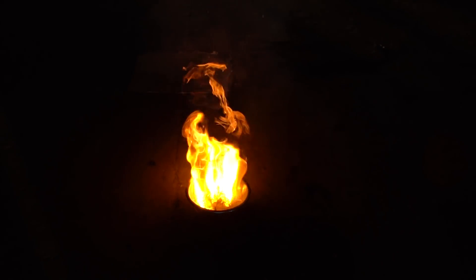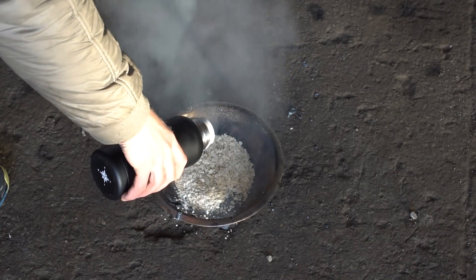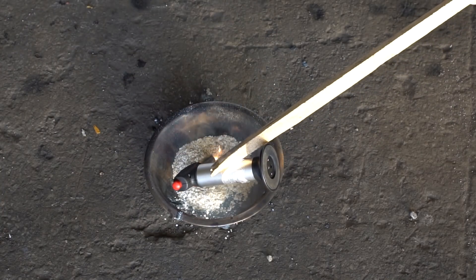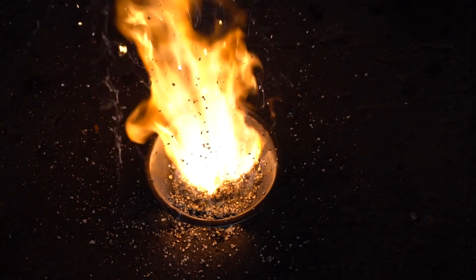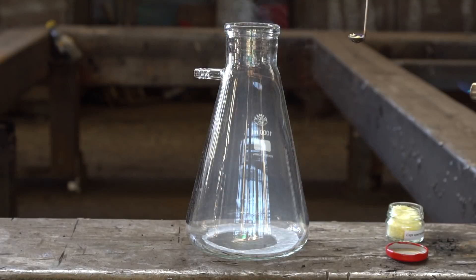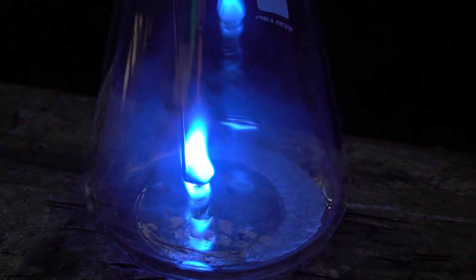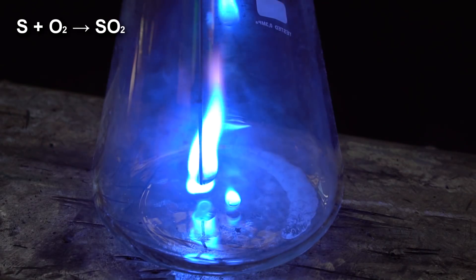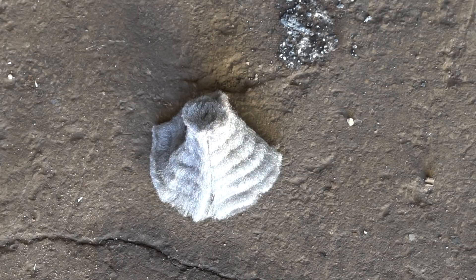During the combustion of chips, as well as everything before, carbon dioxide and water in the form of steam are formed. Also, for those who don't have strong positive feelings towards oat porridge, we soaked it in liquid oxygen and ignited it to show how much energy it contains. Oatmeal is not only full of beneficial vitamins and minerals — it energizes you for the whole day. Also, if you lower burning sulfur into a flask with liquid oxygen, it will burn with a very beautiful blue flame. As a result of this reaction, oxygen and sulfur form sulfur dioxide.